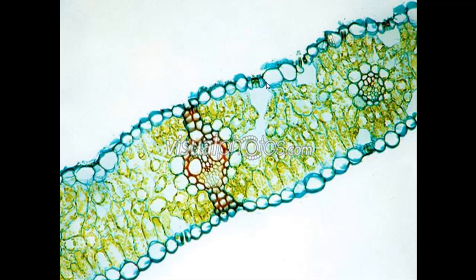I can see here a stomata, some guard cells, definitely here, even some on the other side too. Sometimes we get them on both sides. We tend to get more on the underside of the leaf, but like I said, often both sides. Here's another vein. This is probably the central one, the middle of the leaf, even though the leaf doesn't have that typical fold or V-shape. Here's another one, so bundle sheath cells, some xylem, some phloem.